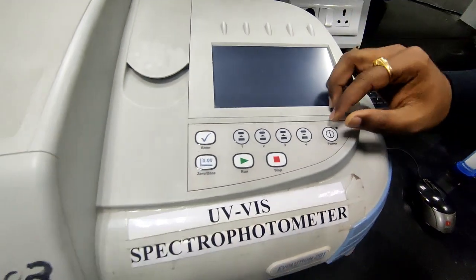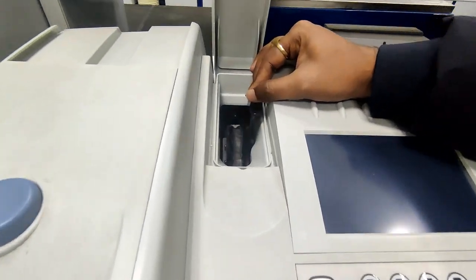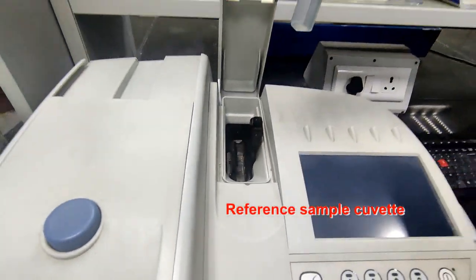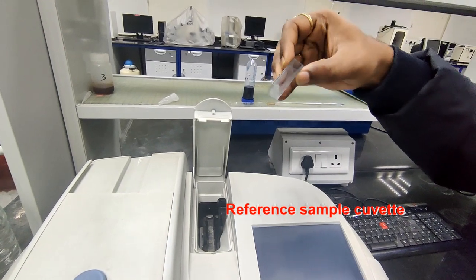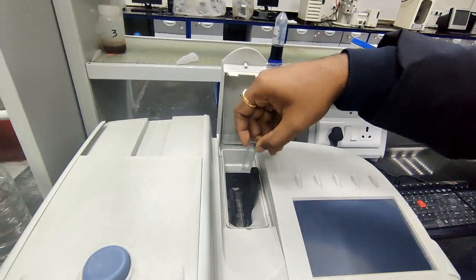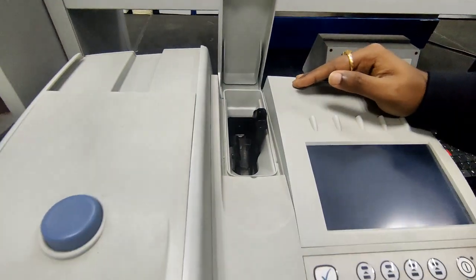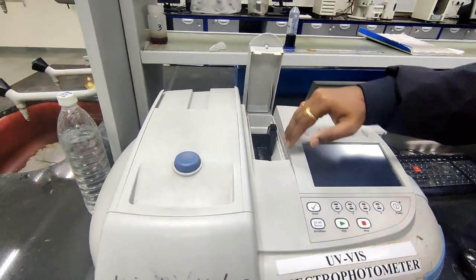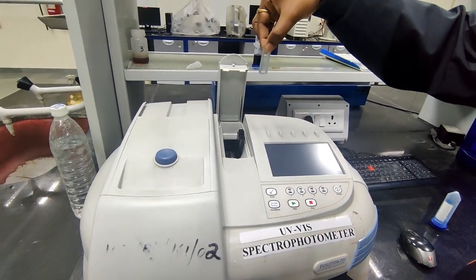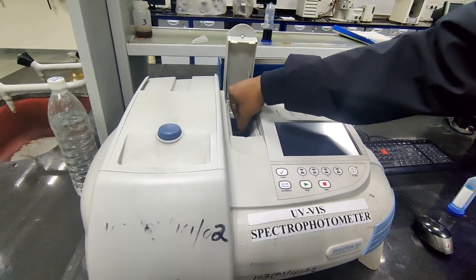Coming to here, we have a reference holder. In this reference holder, we have a cuvette for the reference. We place the reference sample in this cuvette and we place it here. In this UV visible spectroscopy, the beam travels in this direction. So we place the transparent side of the cuvette straight to the beam, so that the beam travels through it.